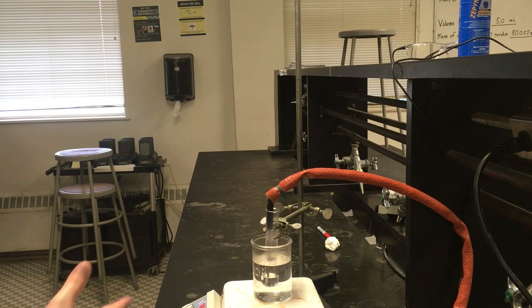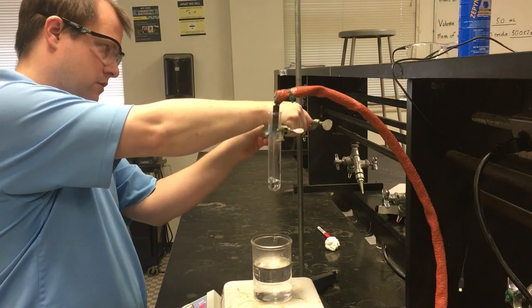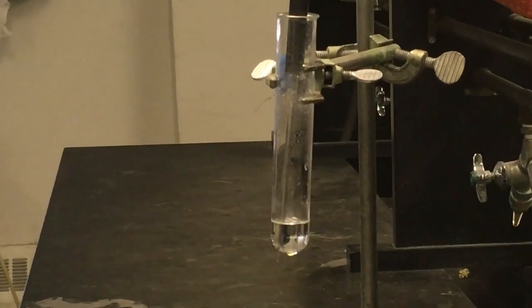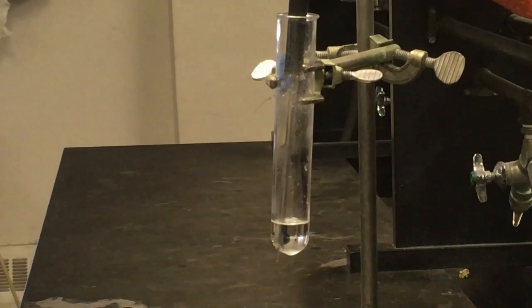All right, so it looks like everything is melted now. I'm going to pop this up and again zoom in our view as best I can. We're again going to zoom in here and see how long it takes for crystals to start forming for this last part. We should expect this to work similarly to last time. Since our second trial also had some contaminant in our naphthalene that caused the freezing point to go down, we saw it go from about 79.1 down to probably a little bit below 70. We probably expect something somewhat similar this time as well.